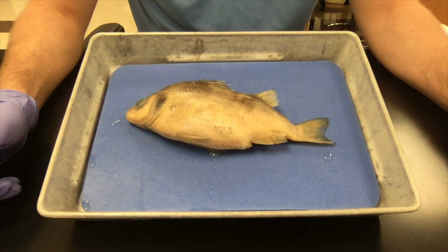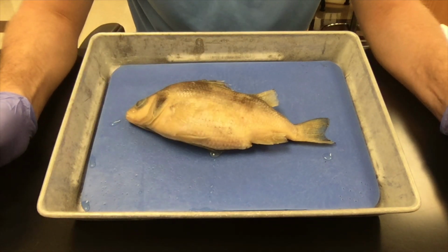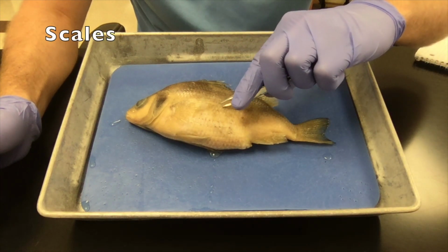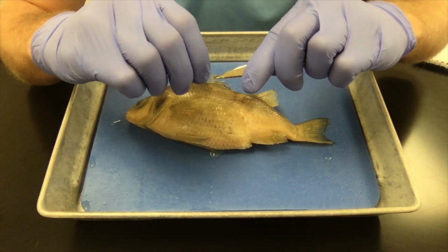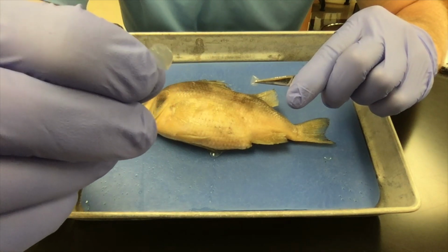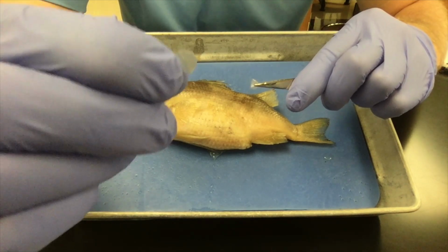Alright, we're going to start off looking at the external anatomy of the fish. One of the most striking things about fish that makes fish fish is the presence of scales on their body. Scales act as a protective coating to protect the fish along with a layer of slime. We're going to go ahead and take one of these scales and put it under a microscope.